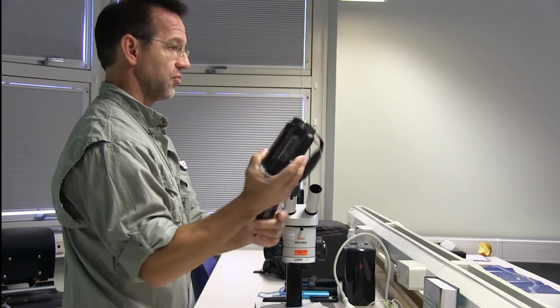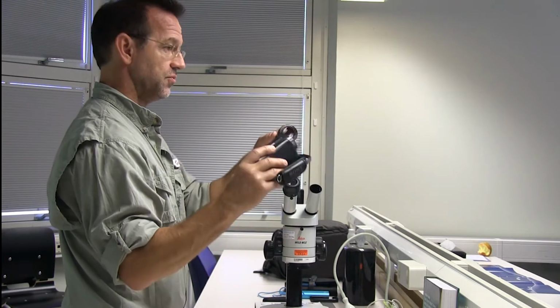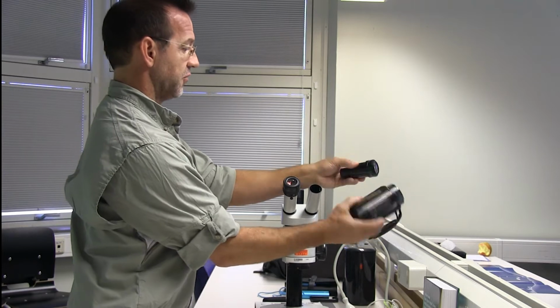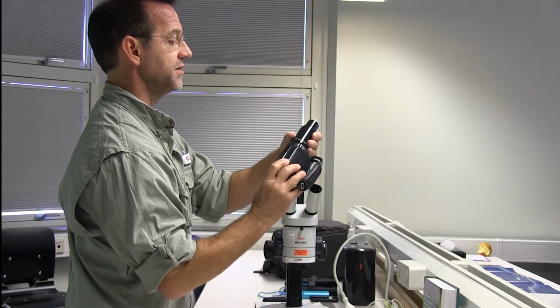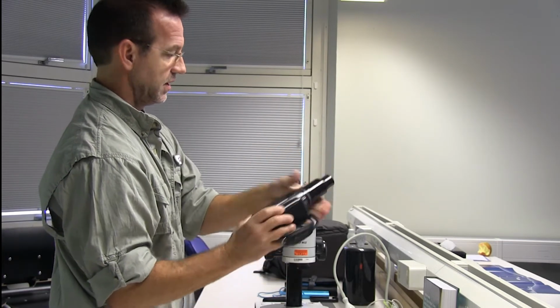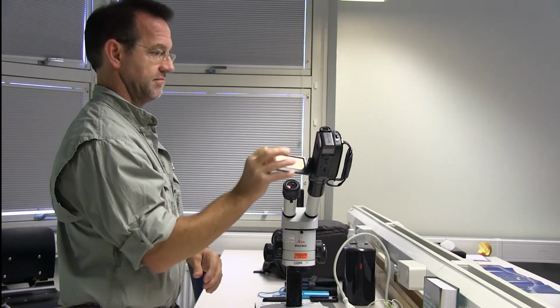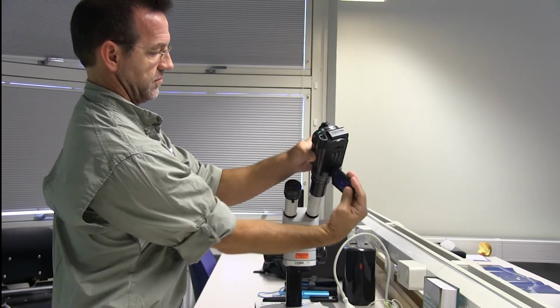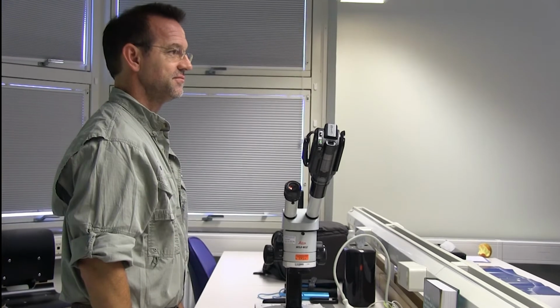So the newer cameras now don't have these threads. You may have to look for an older camera to go with this adapter, or you rig it so that it connects together. But these both have matching threads, so this one can just thread right onto the camera here, like this, and then plug this right in here. And just open that up, and then you have the ability to see what's in the microscope.